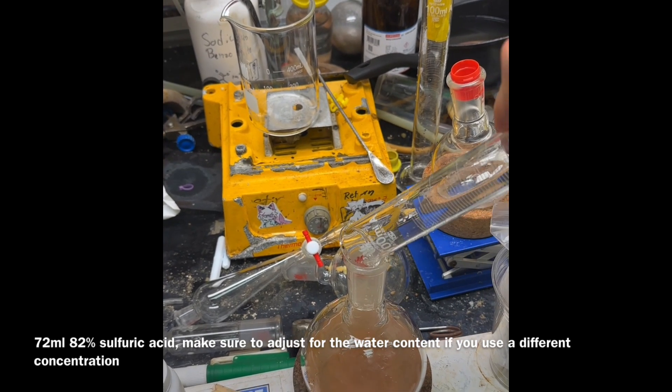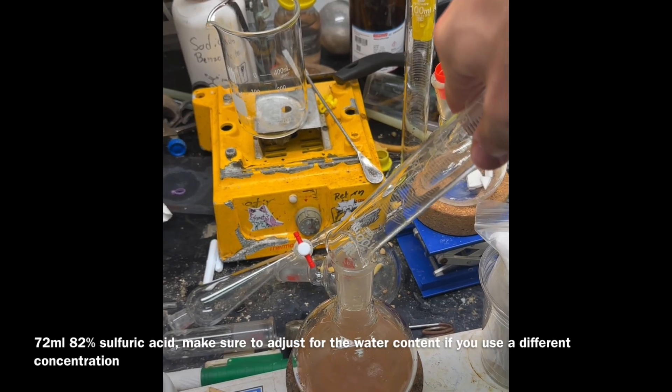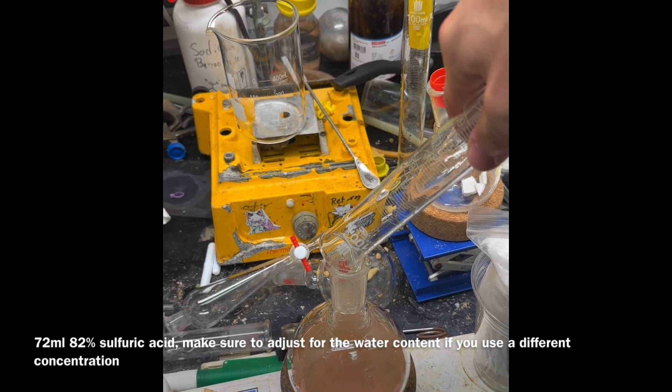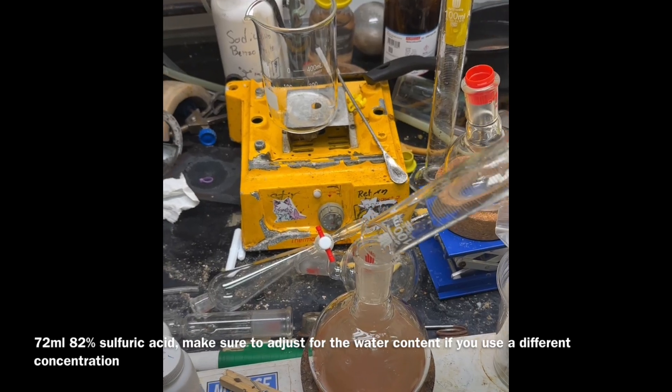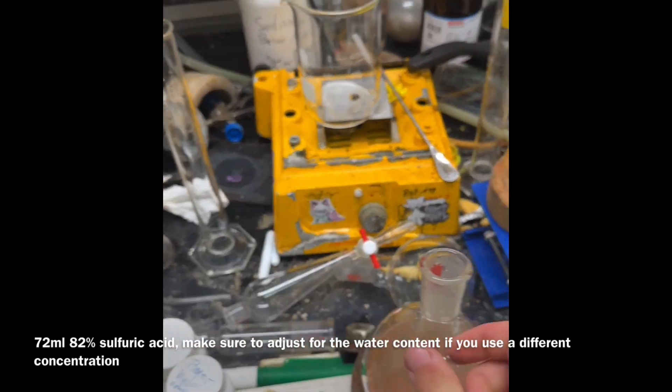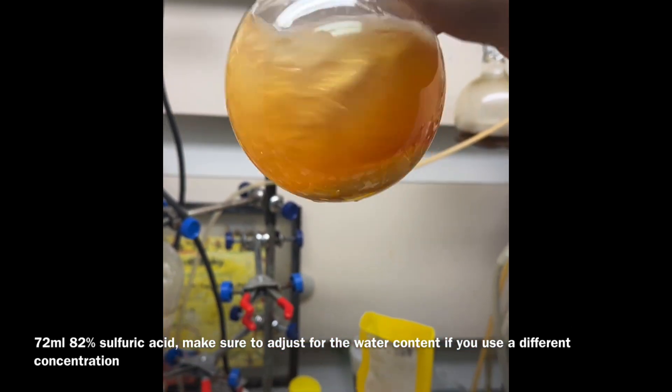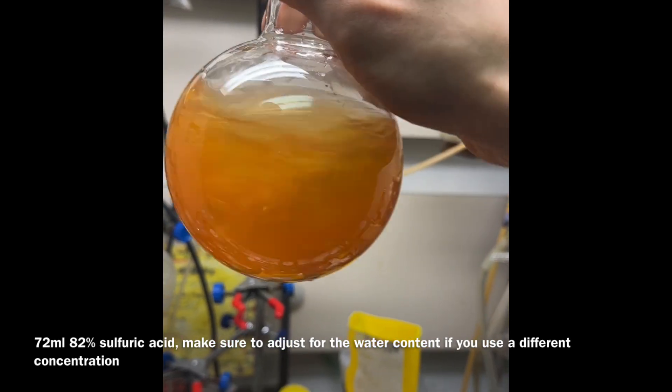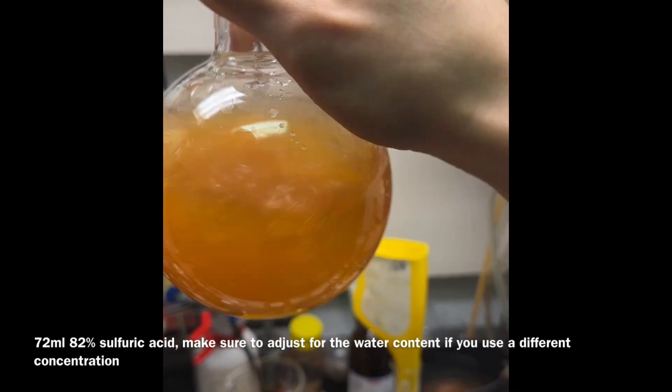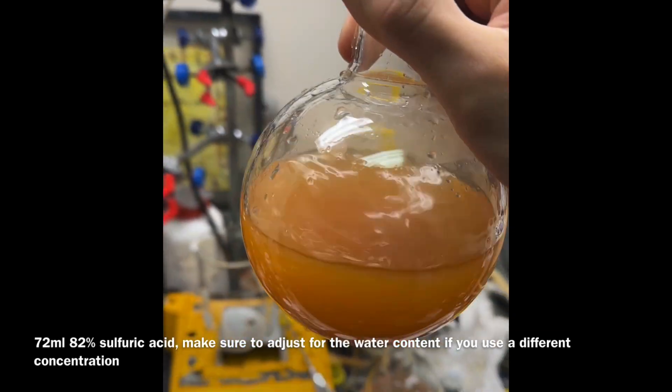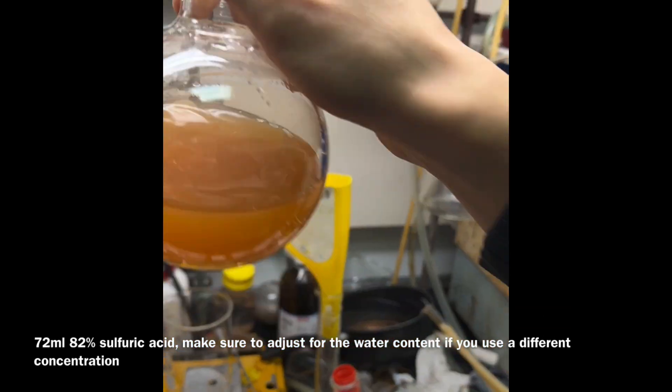The formation of bromine by oxidizing it with aqueous sulfuric acid is not very favorable. It does happen but it's not very favorable. You can see it really is not doing that much. It is not the best color but it really is not going to matter in the grand scheme of things.